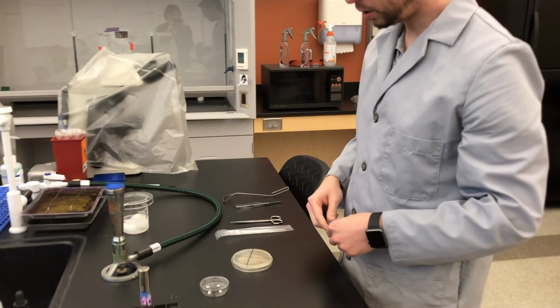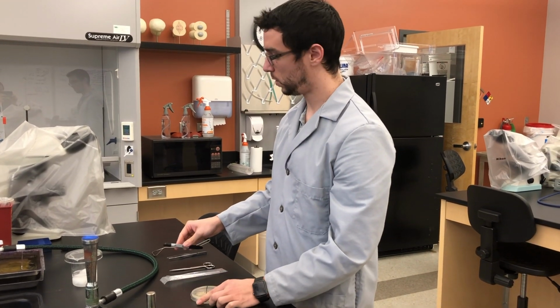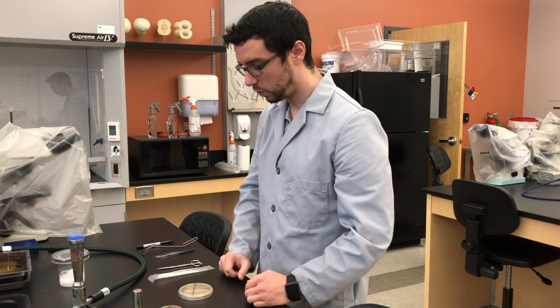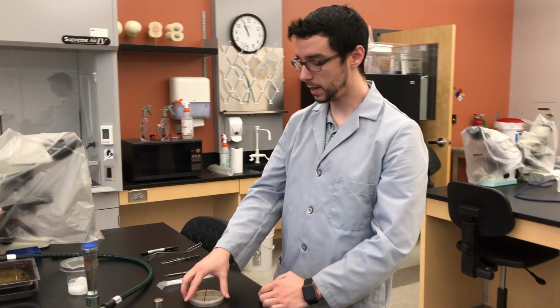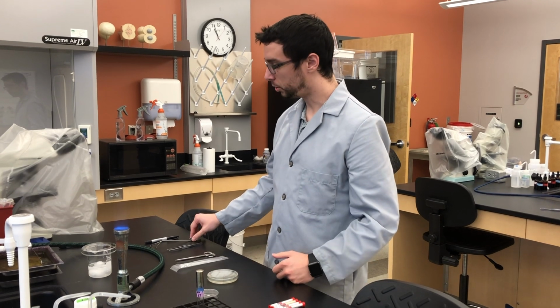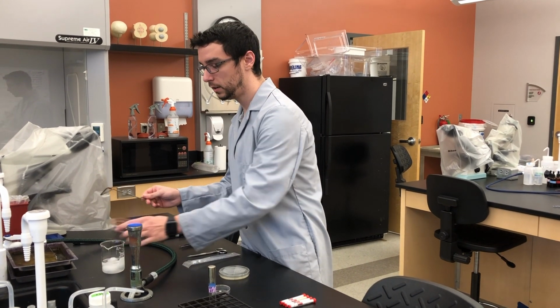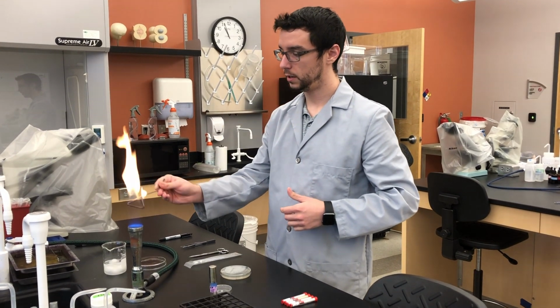Keep the labels small because you want to limit how much the marker is going to get in the way of your assessment next week when you come back to assess your results. All right? So now we've got our plate properly labeled. We're going to flip it over and get ready for the lawn. Just like with the spread plate, we're going to sterilize our spreader in the same way. Dip it in alcohol, and flame it.